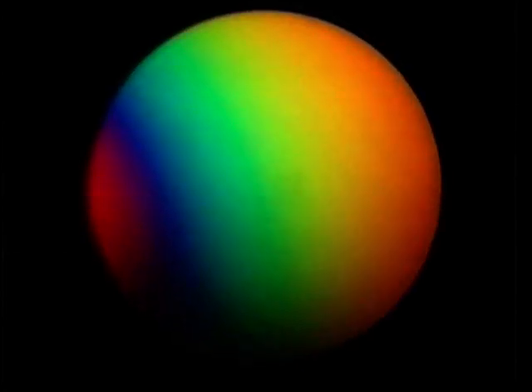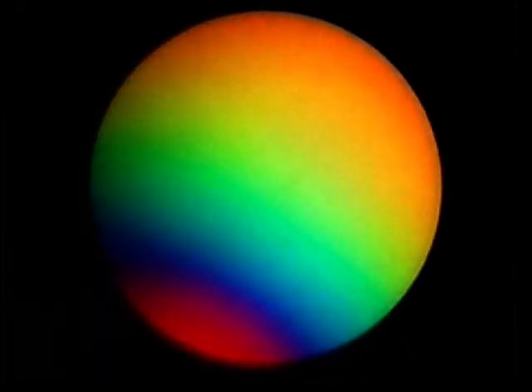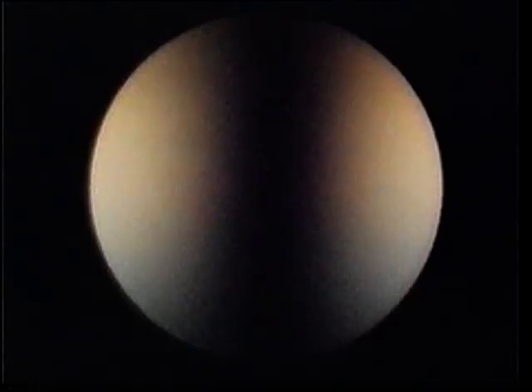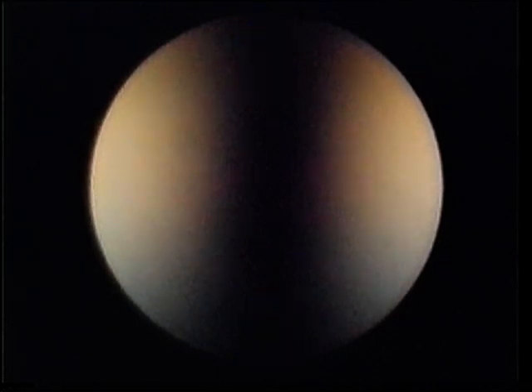Strongly off-centred figures show only a single isogyre and resemble biaxial figures. Recognition of the quadrants, a prerequisite for sign determination, may be more difficult. Here, the optic axis is outside the field, either to the north or to the south along this isogyre. Here's a good rule to use to solve this problem.